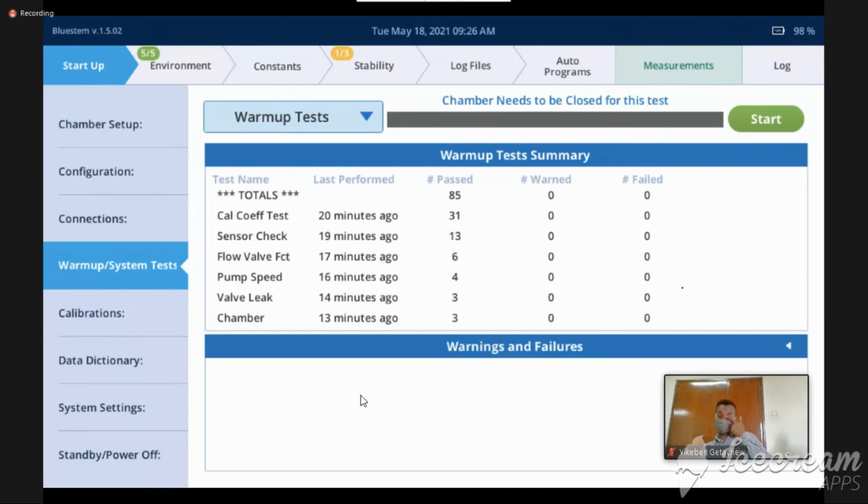Warned means it's a little bit outside of the range that we were wanting it to be, but it's not so much that we're really concerned about. It's something to keep an eye on. If you consistently warn on a test, it might indicate that you need to look into it further. But it doesn't mean I can't do my measurements that day. Often it means this isn't quite where it should be, but here's something you can do to fix it. So in the warnings and failures box, if I had one, it would tell me what test, what the warning was, and what the suggestion was.